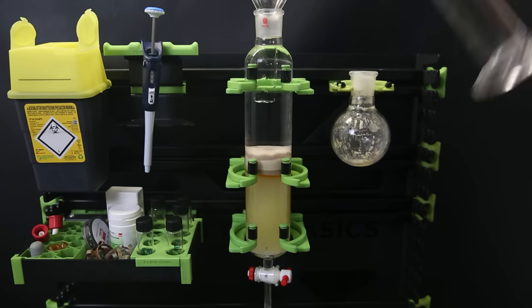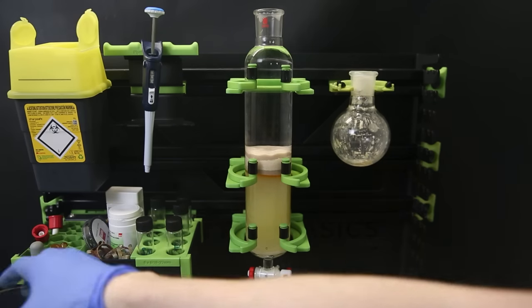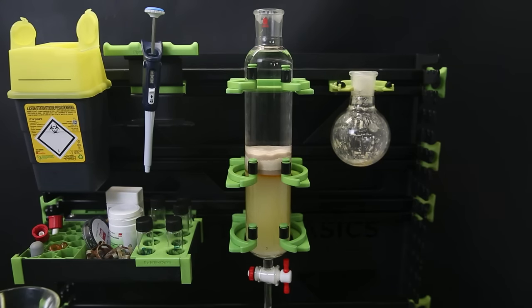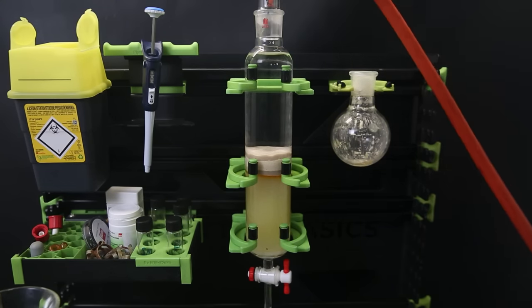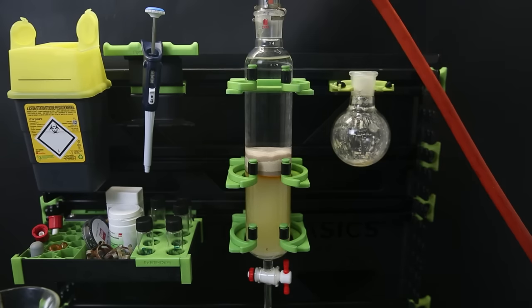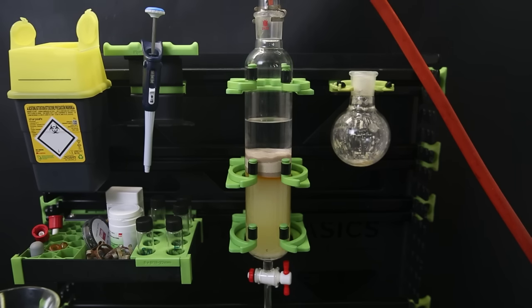In the end, this results in compounds coming off the column separately, and so we can collect them separately as well to get a pure compound. Towards the end, the column was almost completely yellow. I think it's because the product isn't very soluble in the solvent, messing up the separation. But when I increase the concentration of ethyl acetate to 50%, it seemed to all move through better. Because of this, the separation might not be the most optimal.